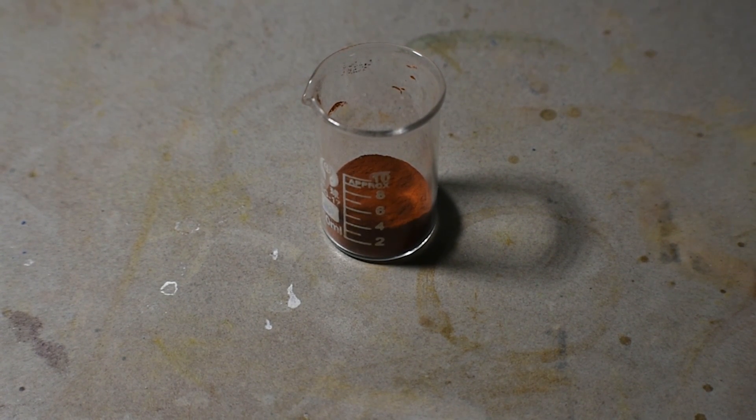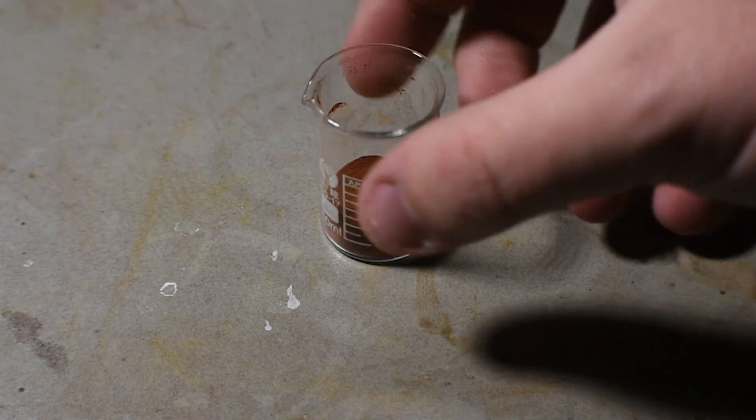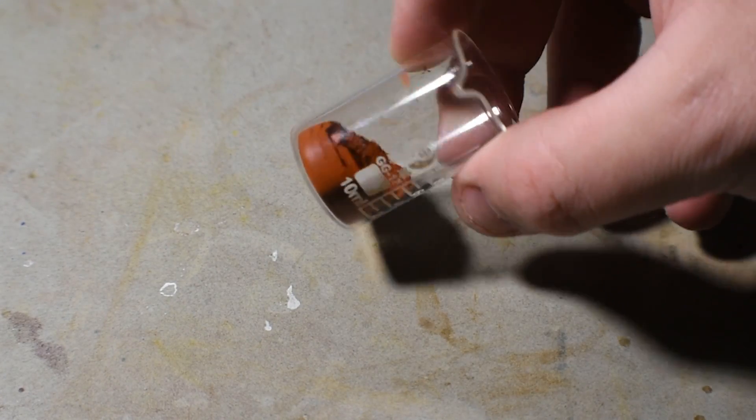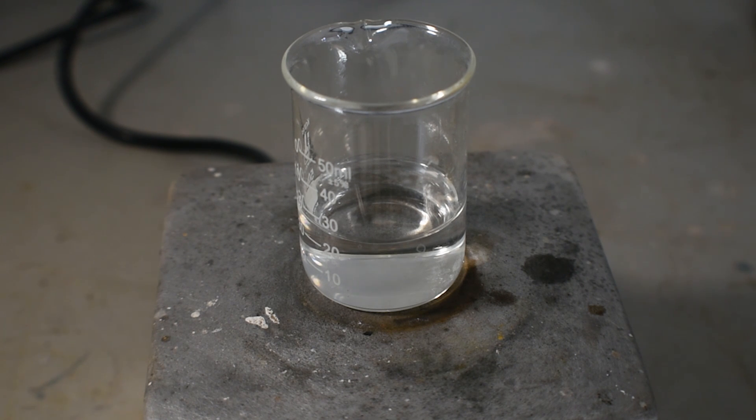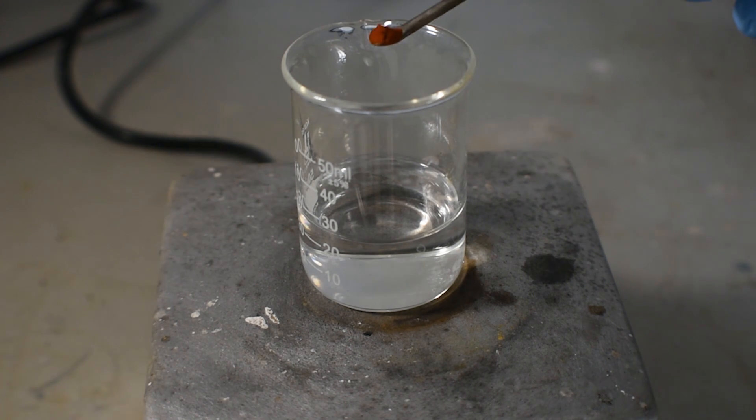All that's left to do with it is to do some tests with our product and then pack it up. The first test involves the reaction of Chevreul's salt with hydrochloric acid. The hydrochloric acid I'm using has been diluted to around 15-20%.